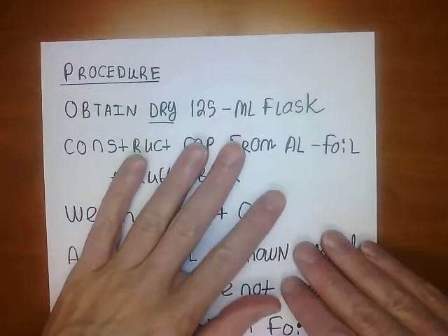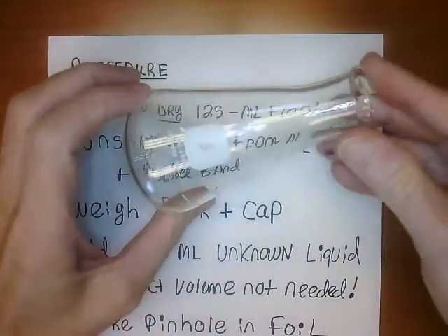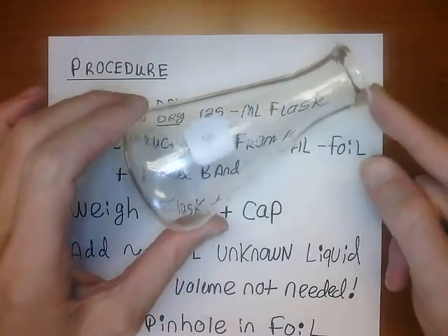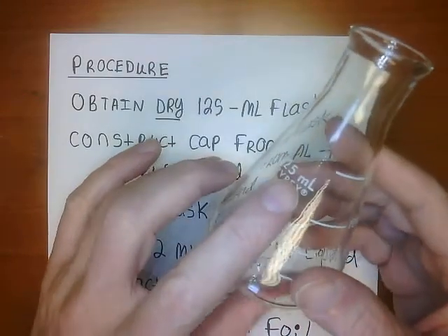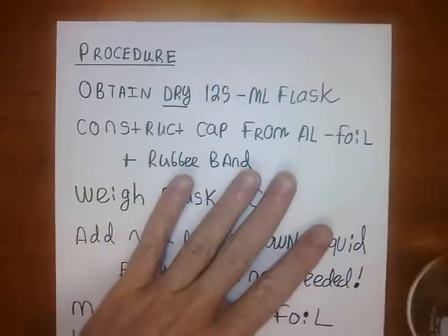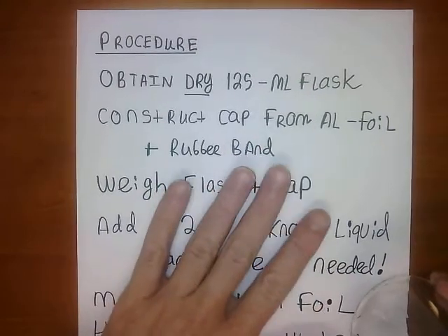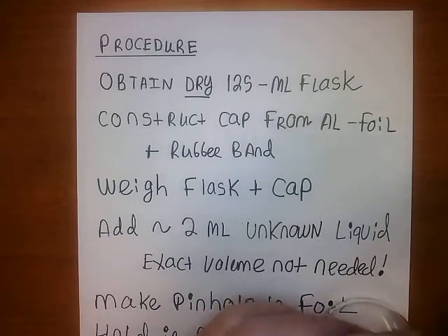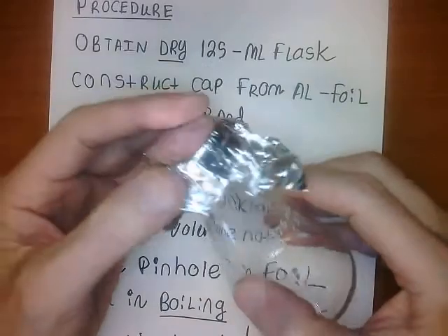First, you're going to obtain a dry 125 mL flask — it has to be dry. If it's not dry, either get another one or dry it out, because it will mess up the experiment. Then we're going to construct a cap for this flask from aluminum foil and a rubber band — a very low-tech approach. We're just going to put the cap on the flask and hold it in place with a rubber band.